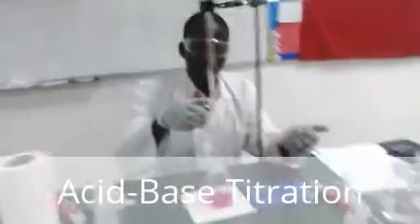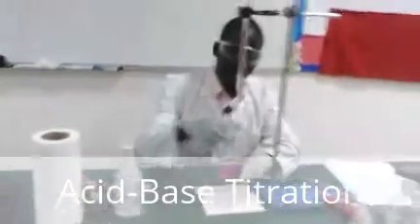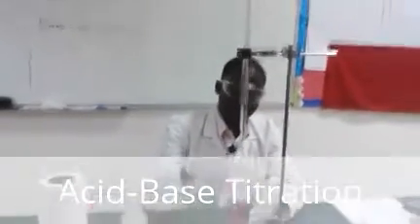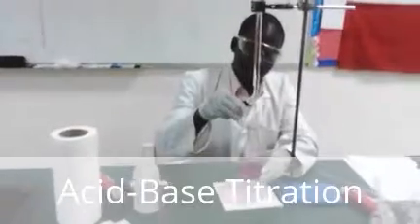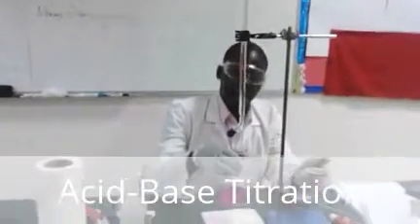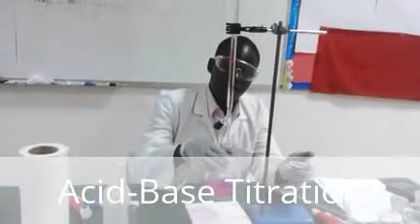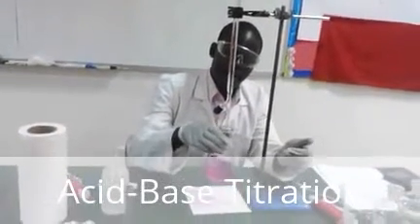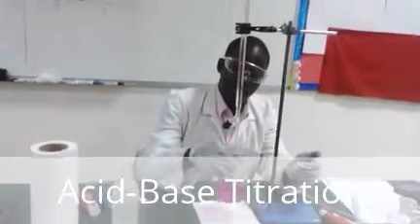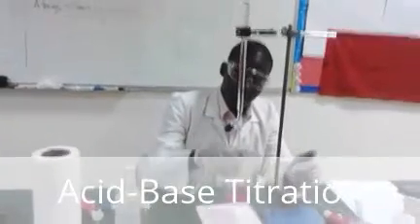Okay, this is our second trial, and still I'm titrating until I see a colorless solution. Remember, we did our first trial and it was 28.5. Now this is our second trial. We want to see an end point.